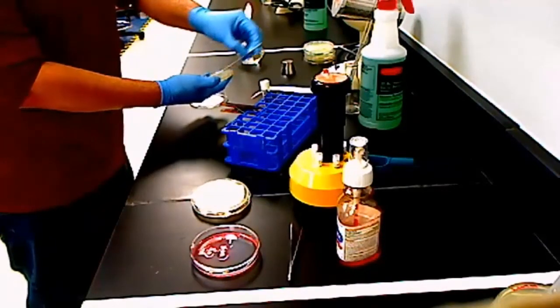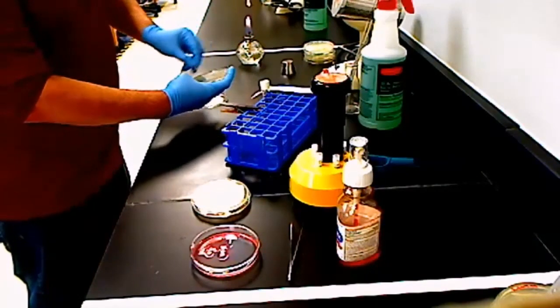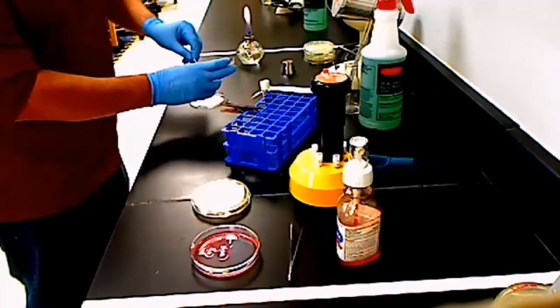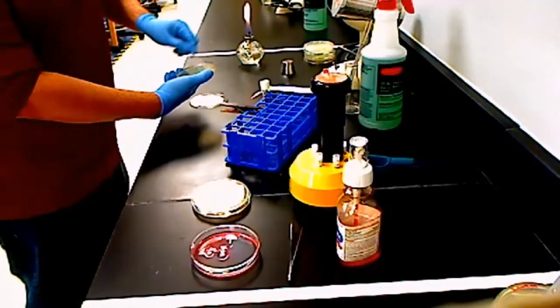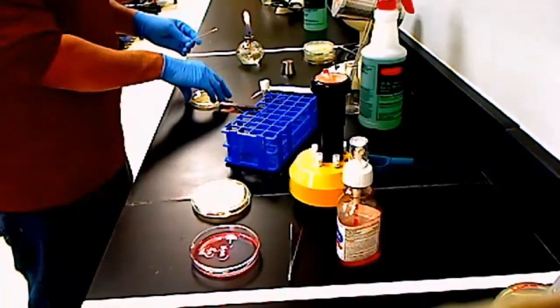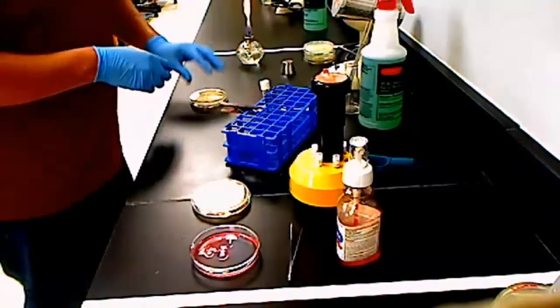Now, to make sure you've inoculated all of the surface of this plate, turn it 90 degrees, and then do it again. You can actually see your streaks if you hold it to the light correctly, and just keep on going around in circles so that you are absolutely sure that every section of this plate has microbes on it. You also want to roll your swab as you're doing this. And you close it up. The swab can go back into this container here. Now you're done with this plate.